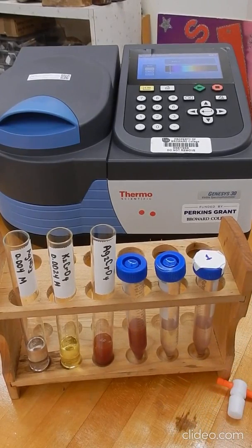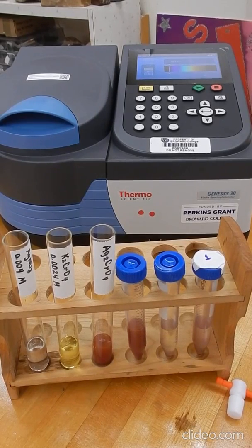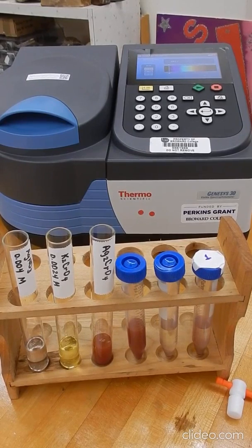That absorbance is the absorbance that we're using in the graph to get the concentration of the chromate ion. So you're finding that absorbance on your y-axis. You're moving to the line that you have for your graph, and from your line you're moving down to approximate the concentration of your chromate ion in solution.